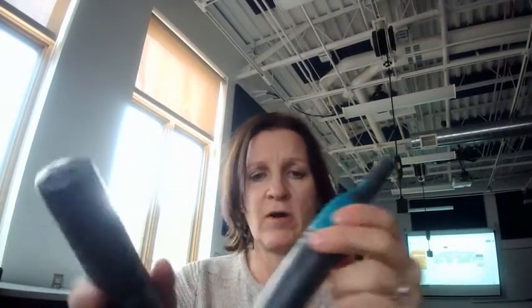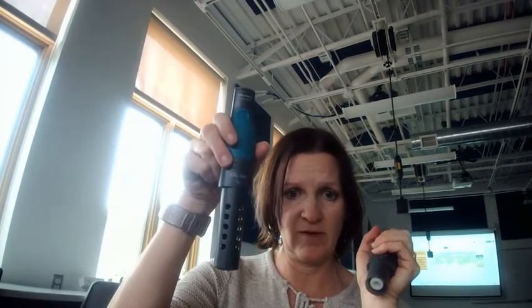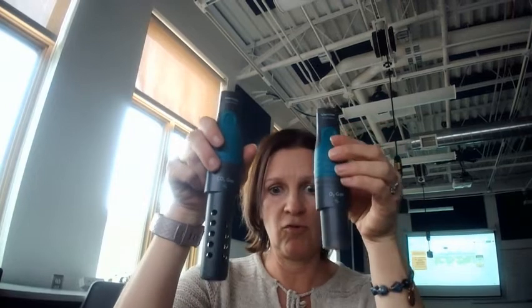You can tell them apart because this one is going to say oxygen gas and it looks shorter. So it's significantly shorter. And this one is going to say carbon dioxide gas and it's going to be significantly longer. You do want to keep them upright, and they're pretty expensive sensors, so we have to be really careful that when you're not using them, they're in their charging station and they're not laying on a table.